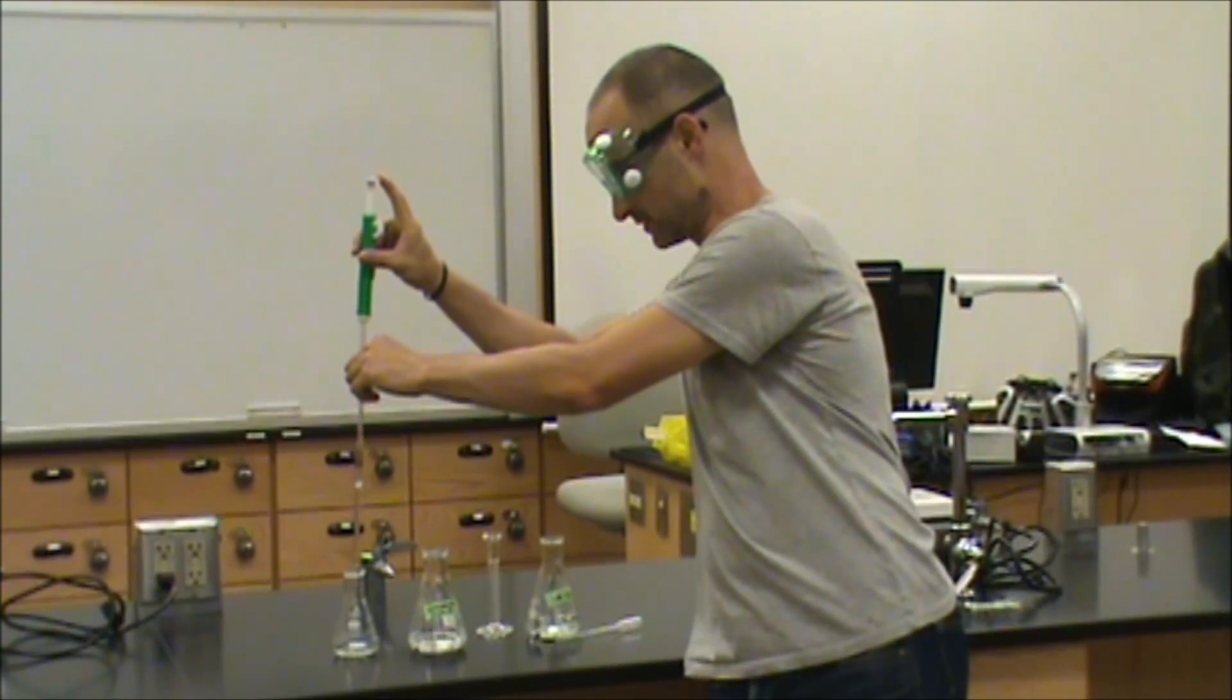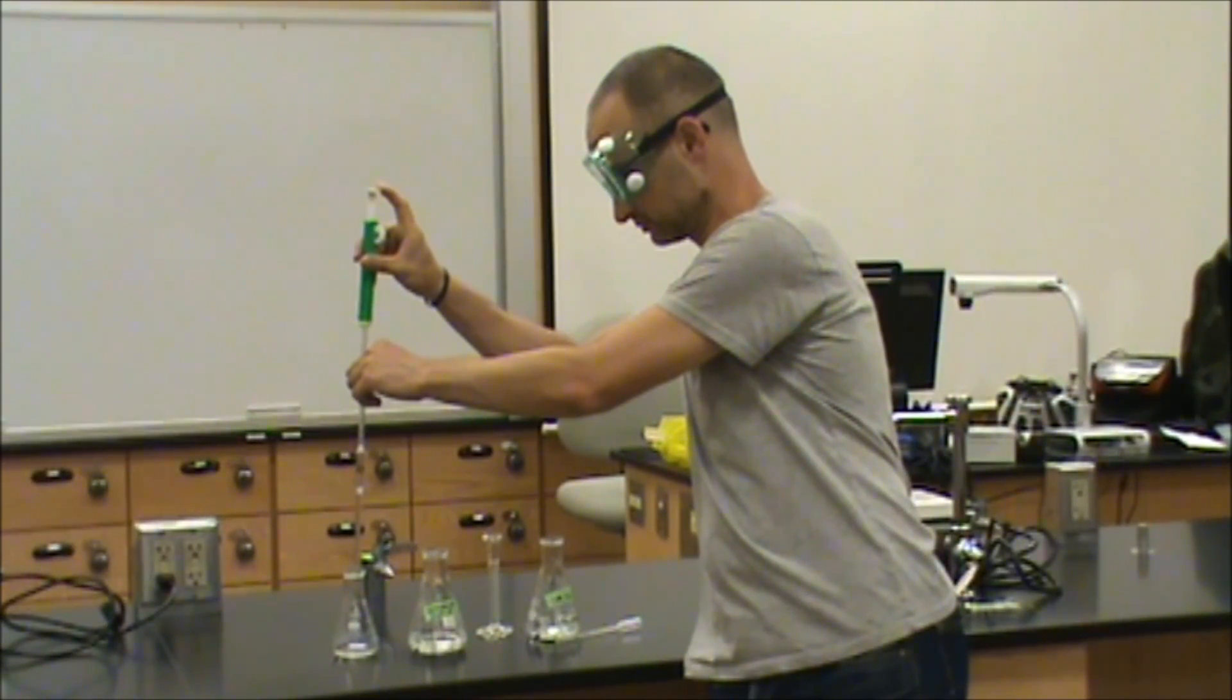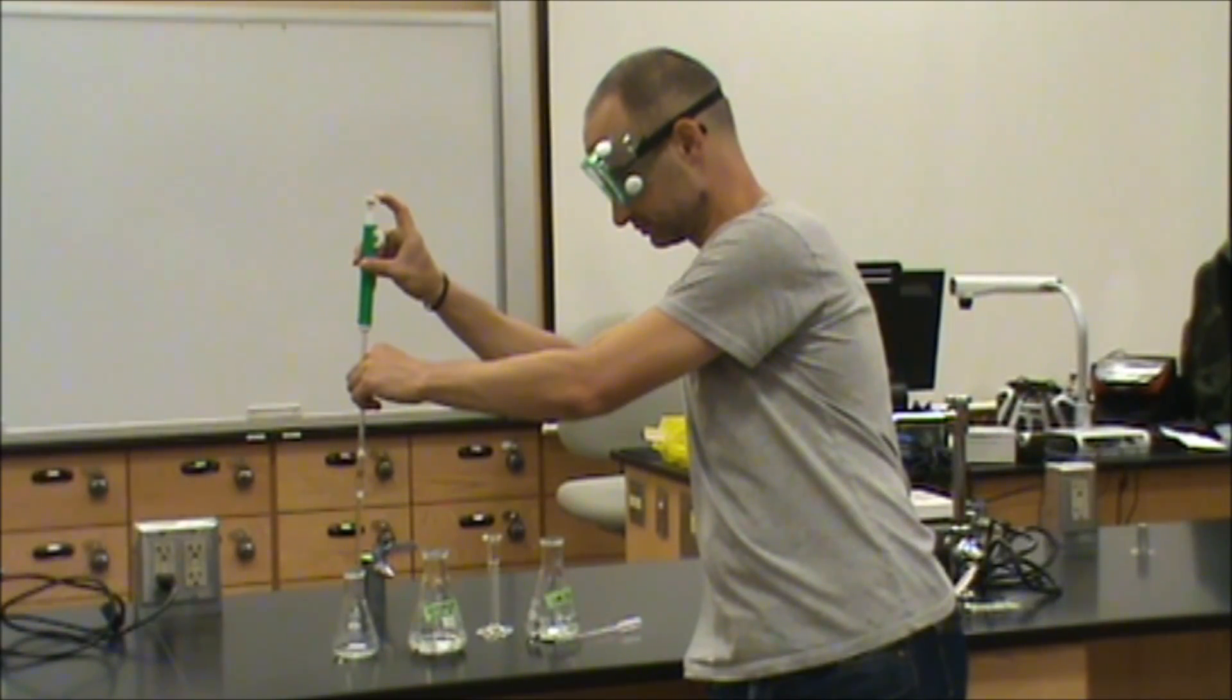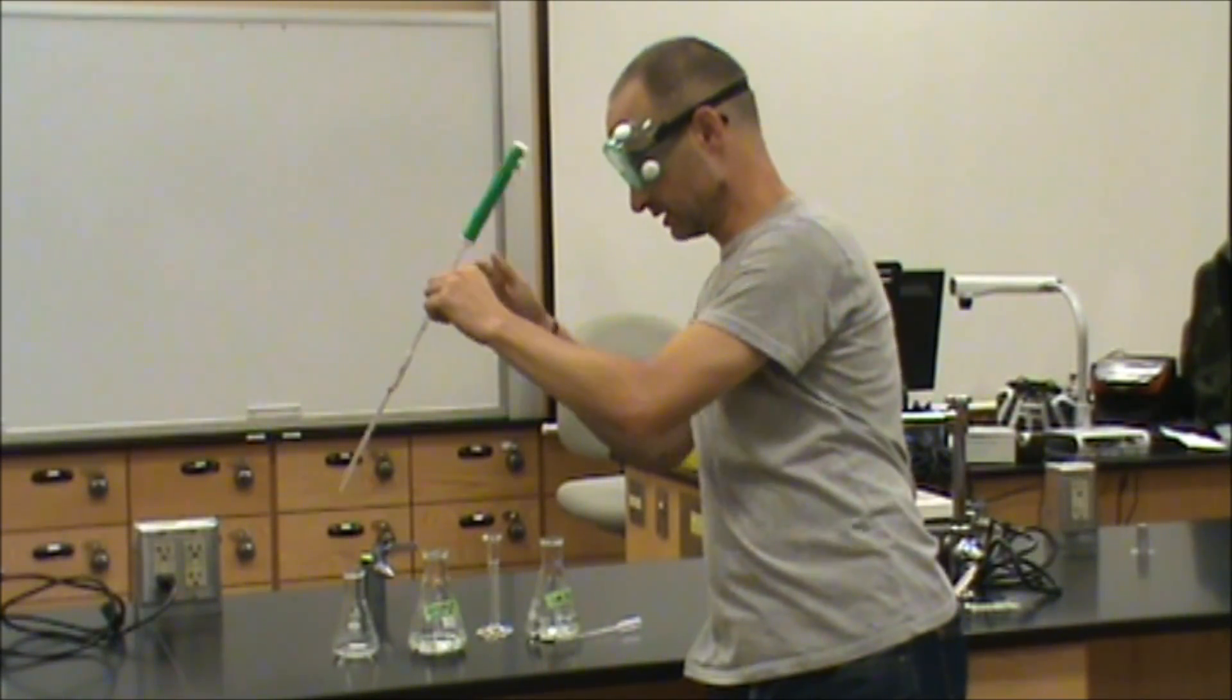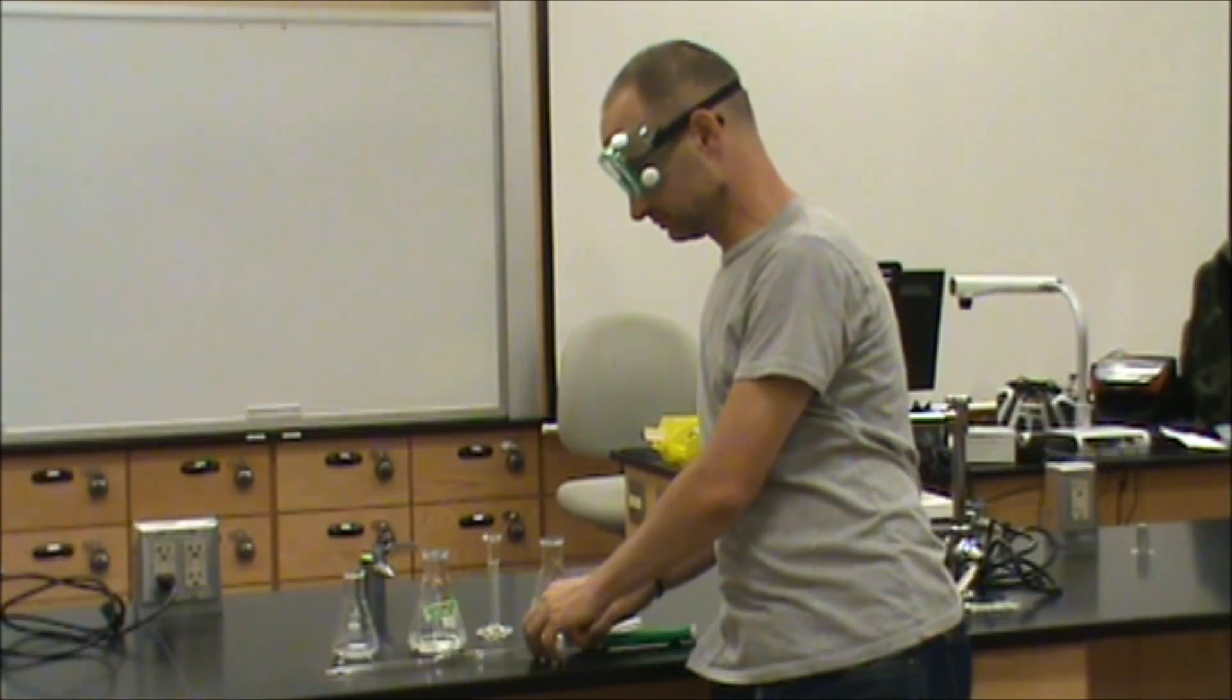I'm now going to transfer that to our 125 milliliter Erlenmeyer flask, and our analyte is now prepared.